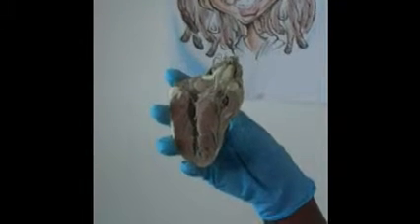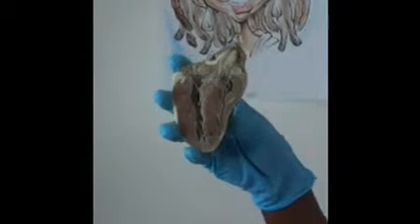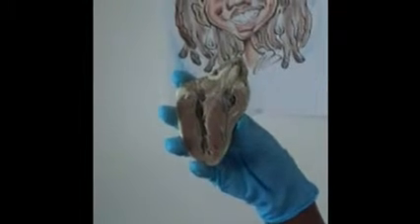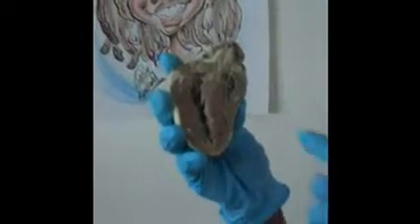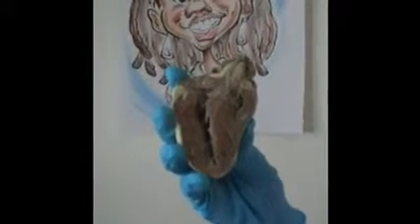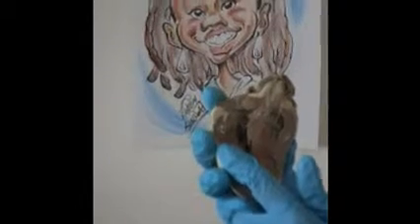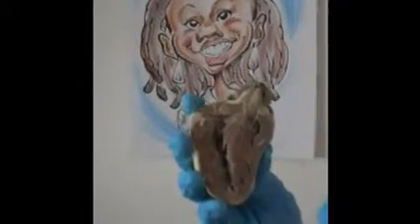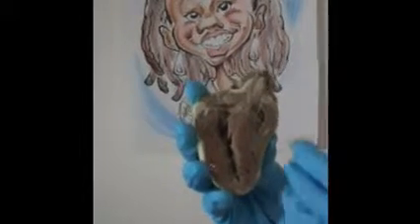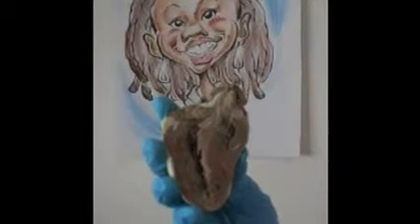Now we're going to move to the internal anatomy of the heart. First we have the pectinate muscles, which are on the inner wall of the right atrium. Then we have the myocardium of the right and the left ventricle. The myocardium is thicker on the left side because the left ventricle pumps the blood throughout the entire body, while the right ventricle only pumps to the lungs for oxygenation.